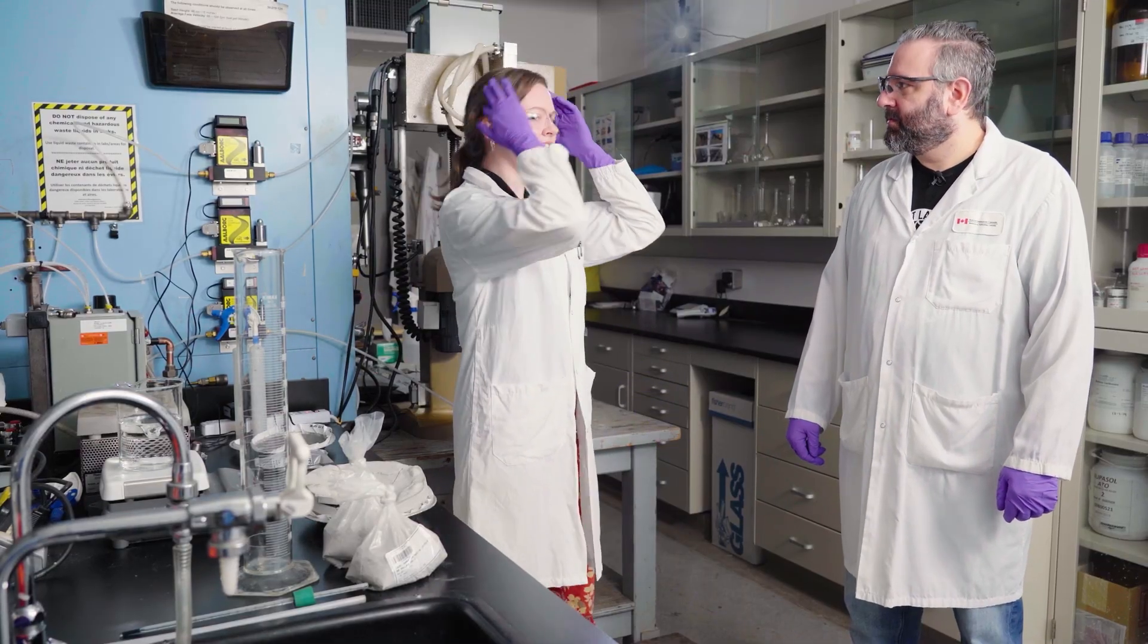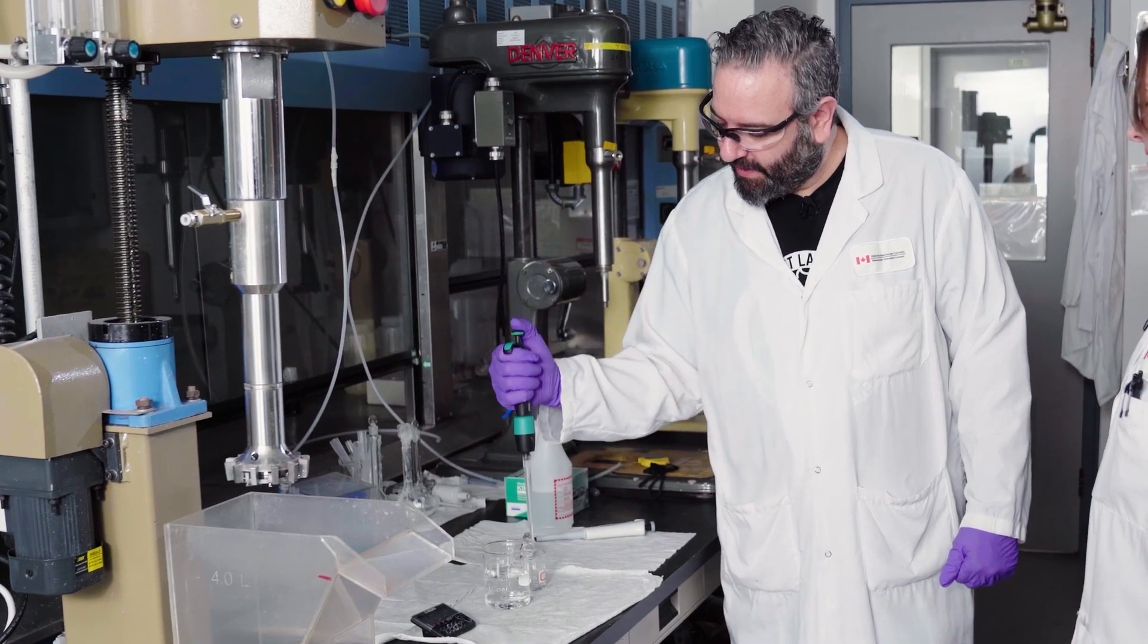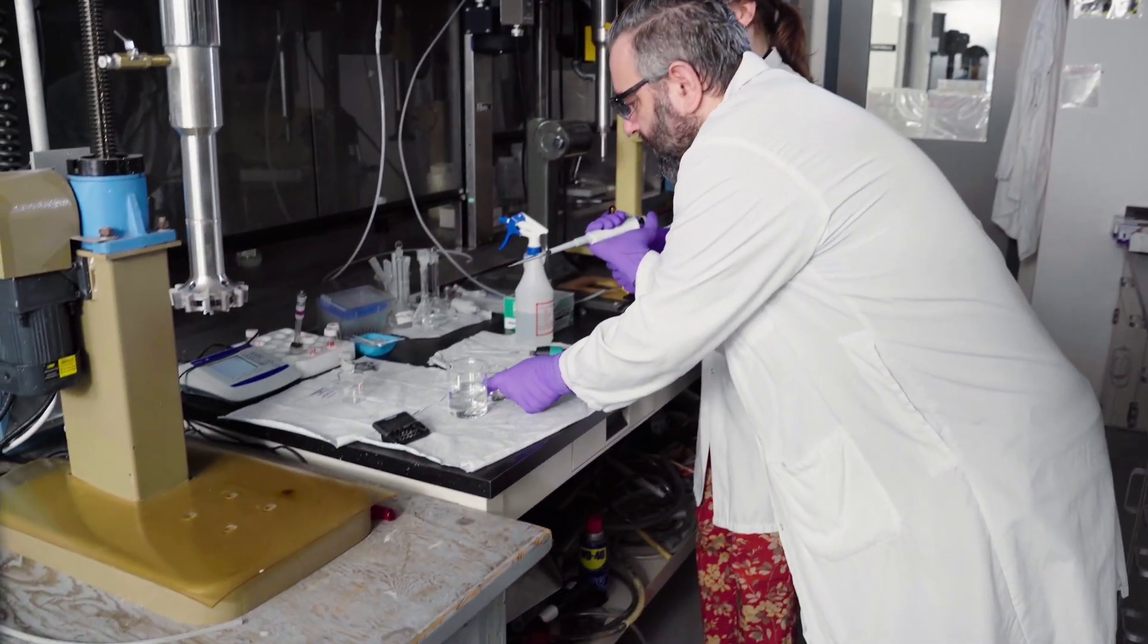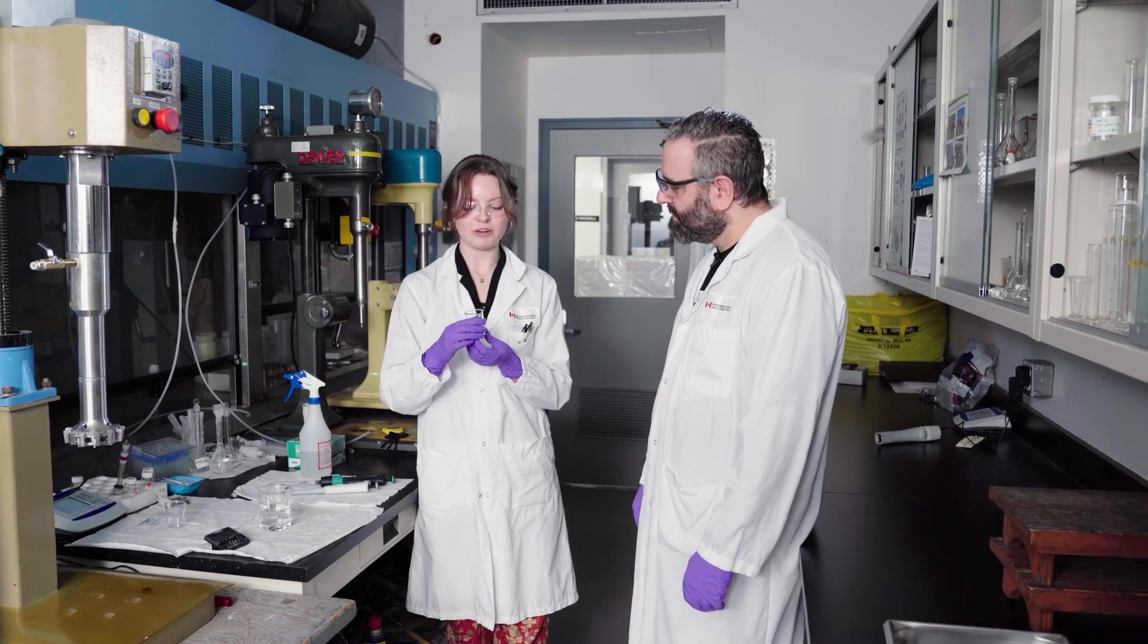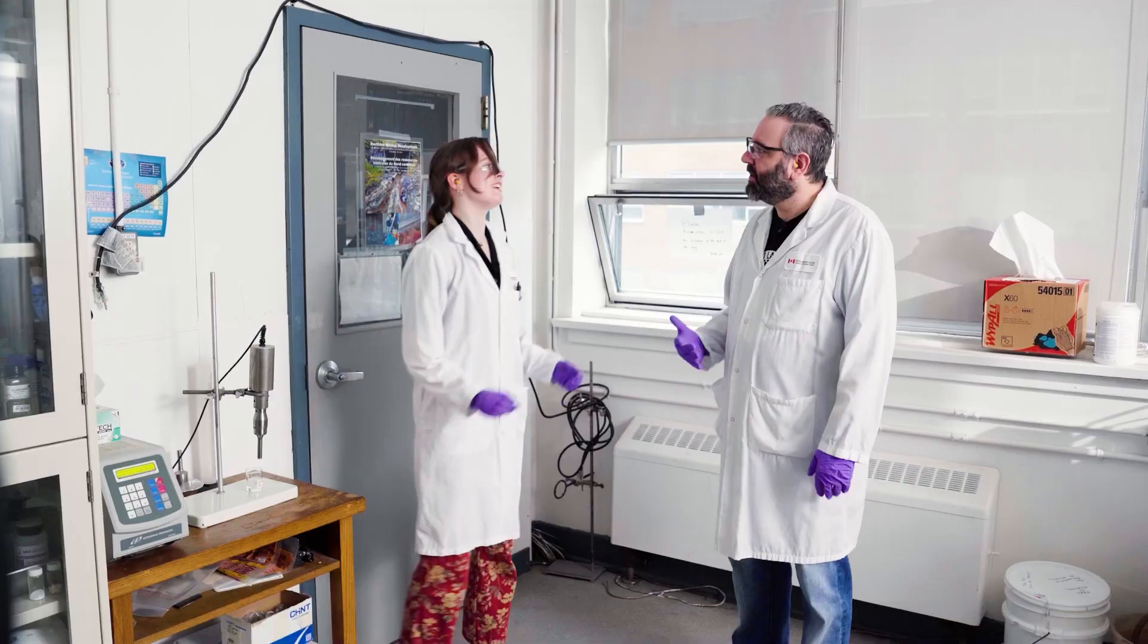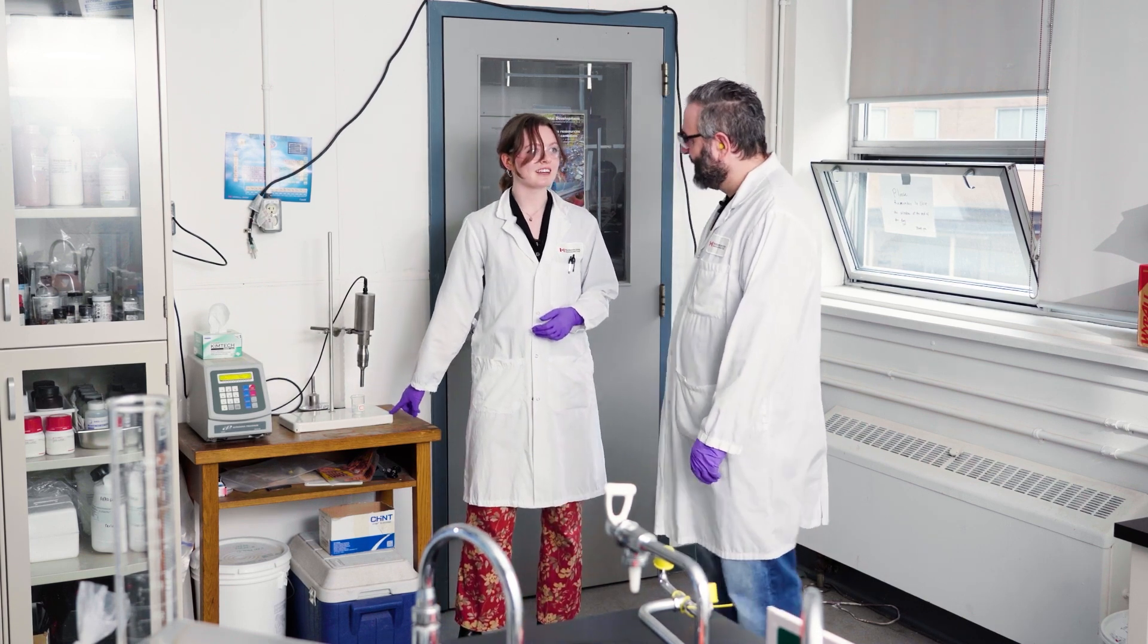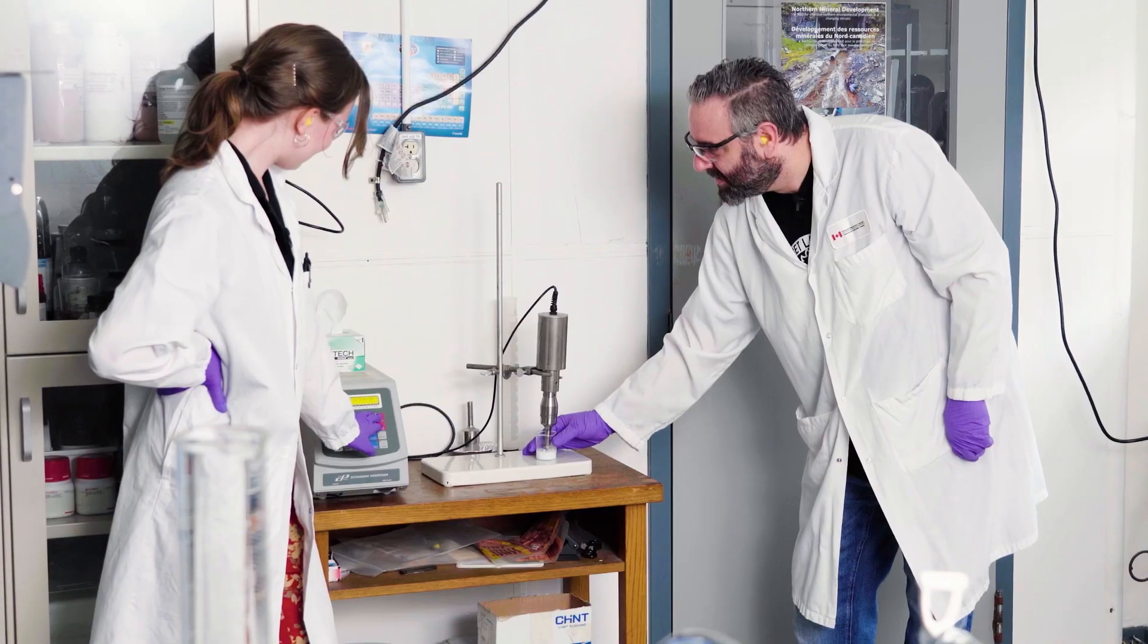So while we're waiting for that to go, we're going to make some transformer oil solution. Press down. All the way. Put it in. Release. There we go. Okay. Now press down all the way. All the way. Now you can use transformer oil. How's that? Beautiful. Okay. And put it in the little one here, right? Yeah. So we just put oil in water, and famously, they don't mix very well. So we're going to have to sonicate this. This basically vibrates really fast and it's going to agitate this mixture so much that the oil is dispersed. Before you do anything, you want to make sure that the amplitude is at 40% or lower or else it'll break your glassware, which I've done and it sucks. Another important thing about these experiments is that everything has to do the same every time. So I always do it at exactly 40% for two minutes.